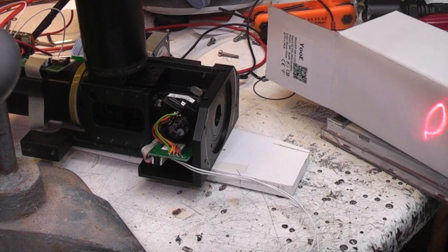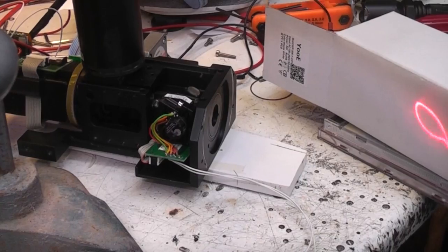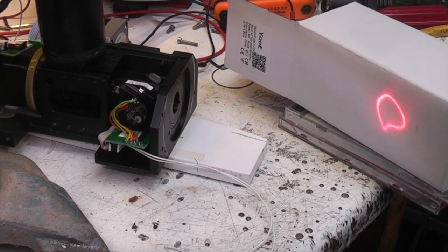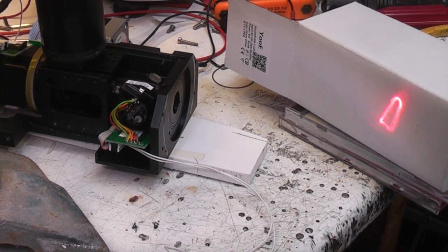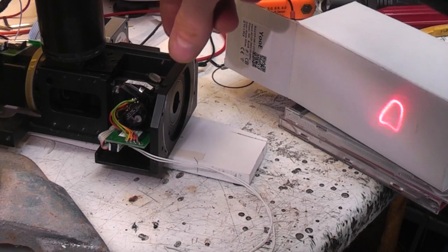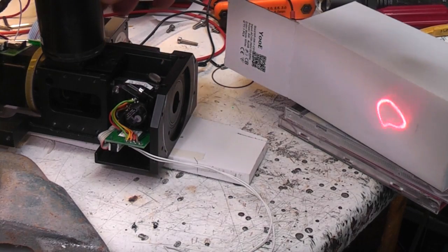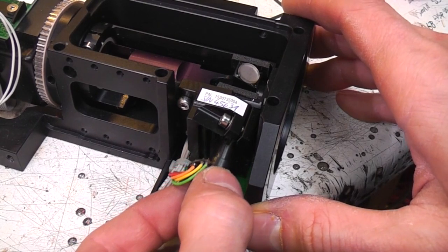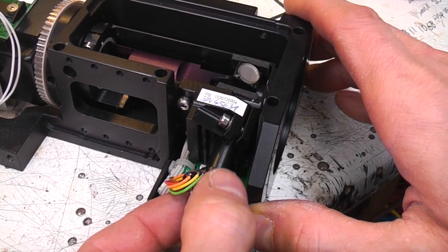And of course this in combination with the acousto-optical things means you could actually get quite a nice sort of modulated laser system going. I don't know whether the speed of the acousto-optical stuff in these scanners is actually comparable to the sort of thing they use in laser show type projectors. I think one issue is the axis that's driven by this rear one is very heavy because it's got that fairly big metal block to support the rotation and so on, so I doubt you'd get a particularly fast scan rate in that axis, but the other one's got a tiny little mirror, so that's probably a fairly fast little unit. This is the smaller of the galvanometers.